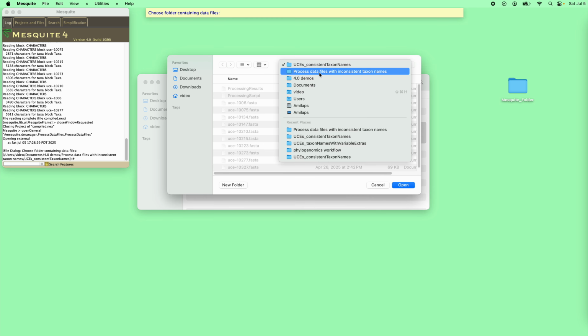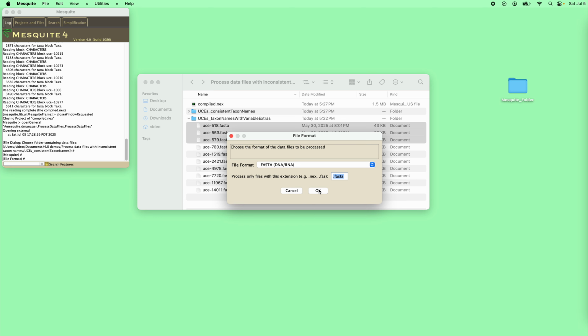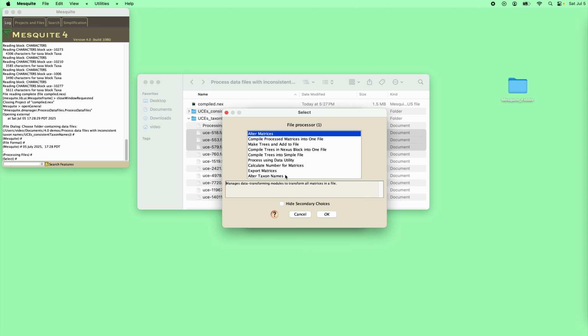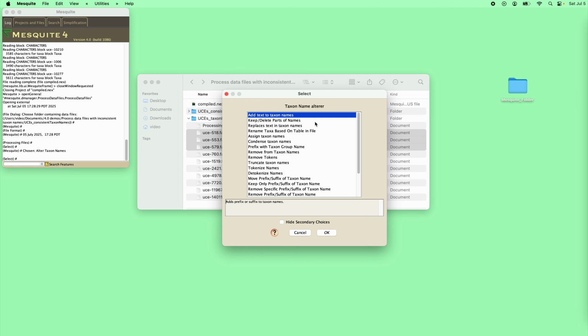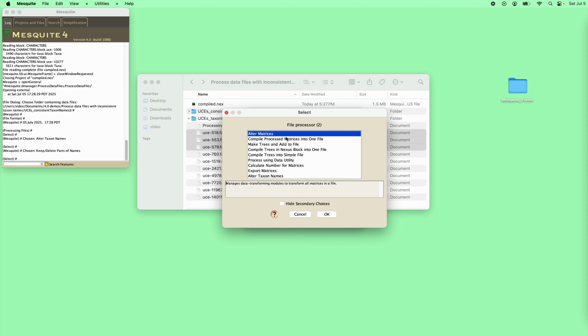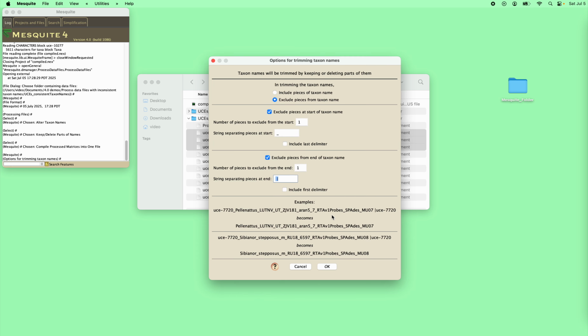We're going to choose the other directory, the one that's a little bit messy. We're going to continue like this, but here we're going to clear so that we can add a first step of altering the taxon names. And we're going to alter the taxon names by just deleting certain parts of them. And then we're going to add the step here of compiling them. And here we go.